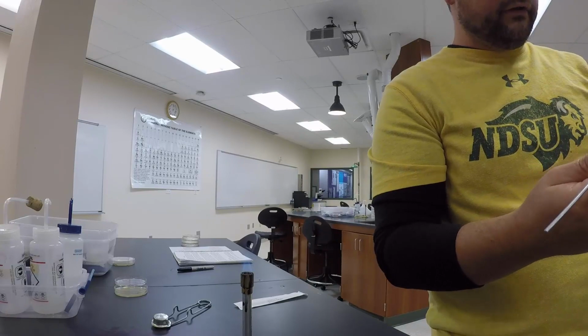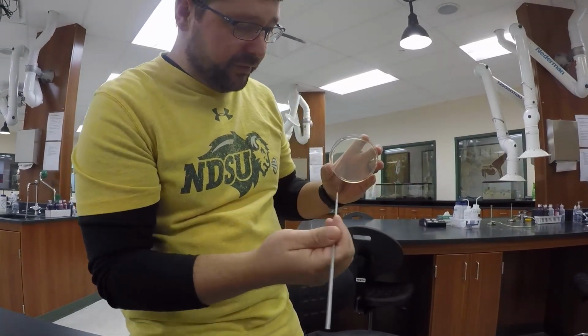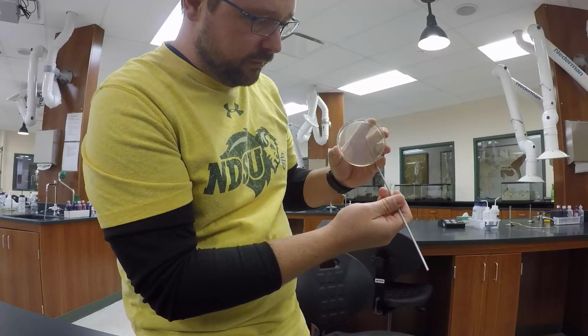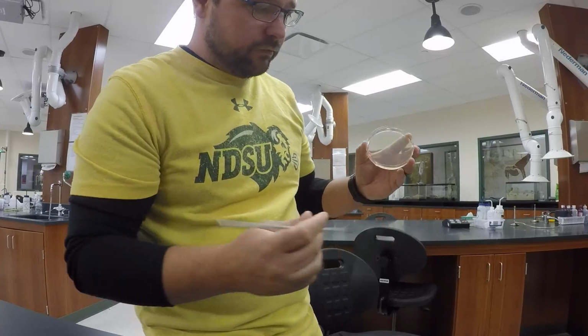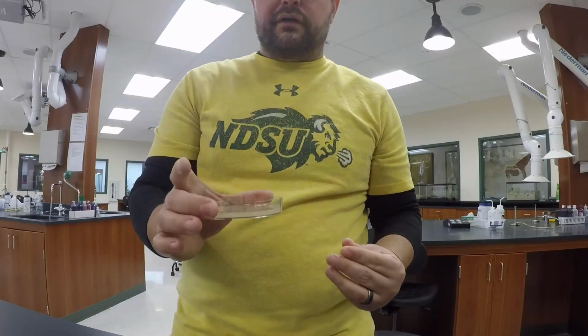And then I rotated the plate. I rotated the plate 180 degrees. So I'm going to make sure it's cool. So I'm going to touch it outside on the edge there. Go to the center. I'm going to grab that bacteria that's still in the center, and I'm going to move it to this edge. So that's what I call a modified continuous inoculation.